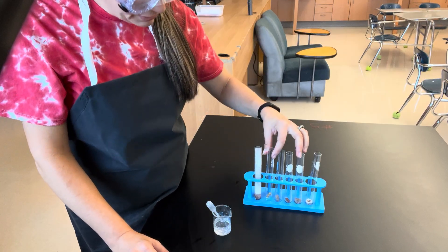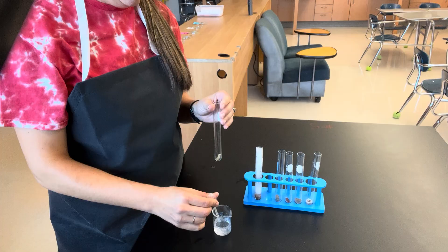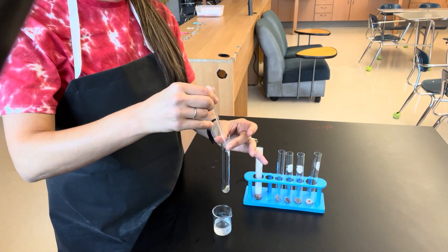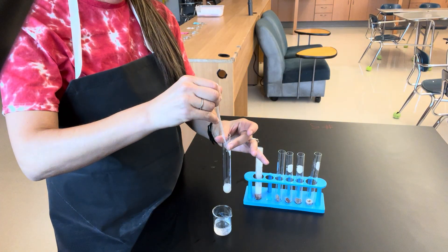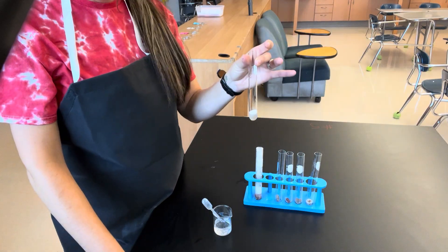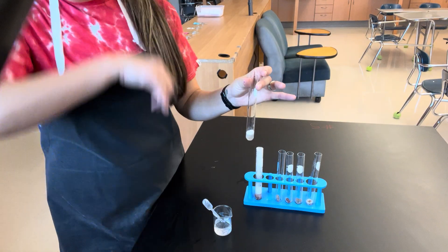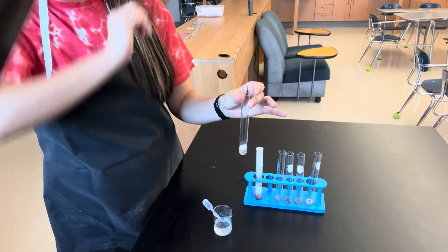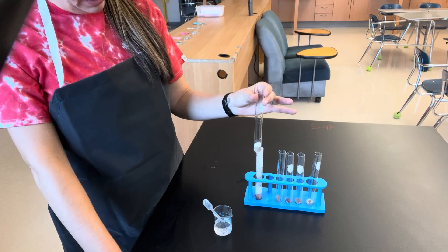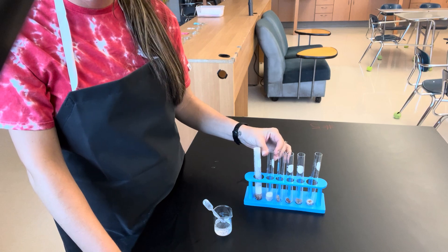Now we're going to look at potato — let's see what potato enzymes do when they react with hydrogen peroxide. We see some bubbles forming, but not nearly the amount of bubbles that formed with our first test tube reaction.